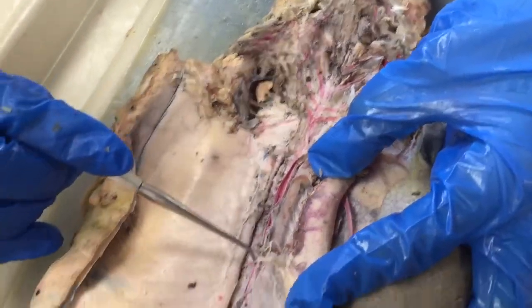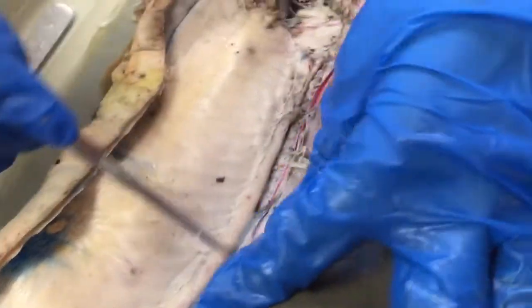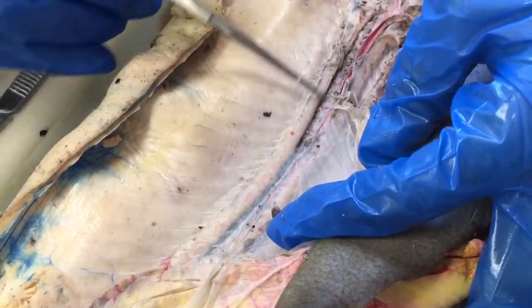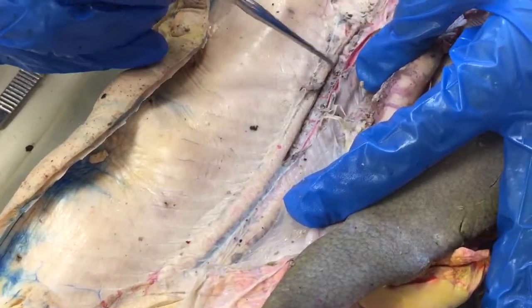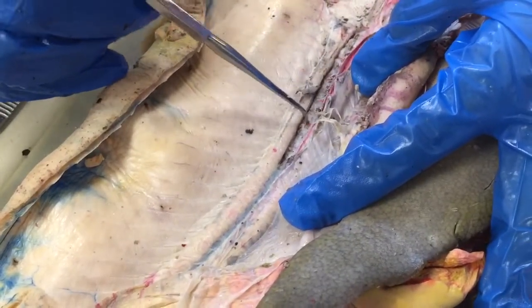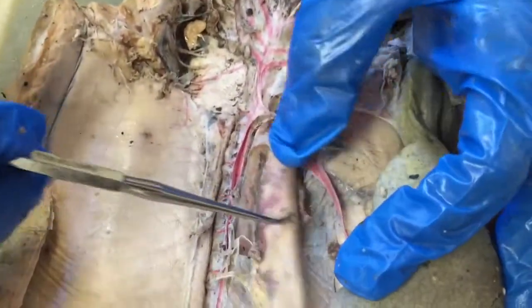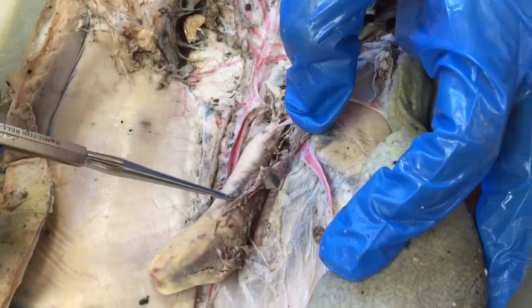This large branch here going towards the testes and organs is the celiac artery — spelled with a C. As the dorsal aorta goes down, you can also see a dark line on either side — that's the corresponding posterior cardinal veins. These small arteries coming off the dorsal aorta are called segmental arteries. You can see small arteries along the testes here — those are testicular arteries.